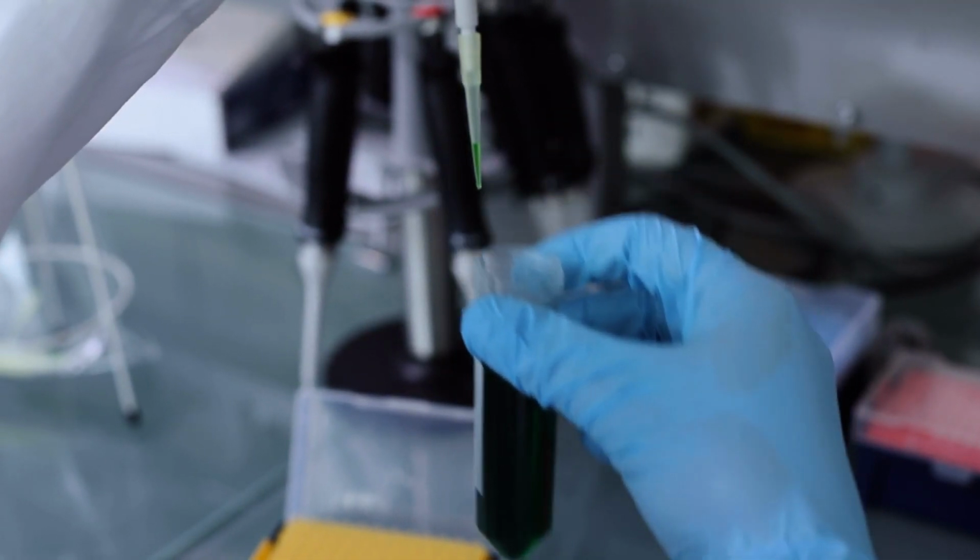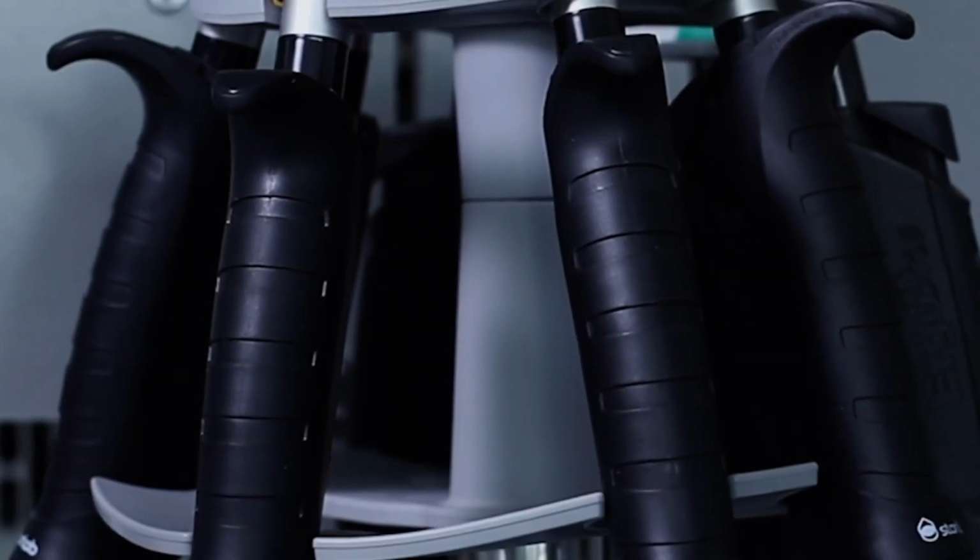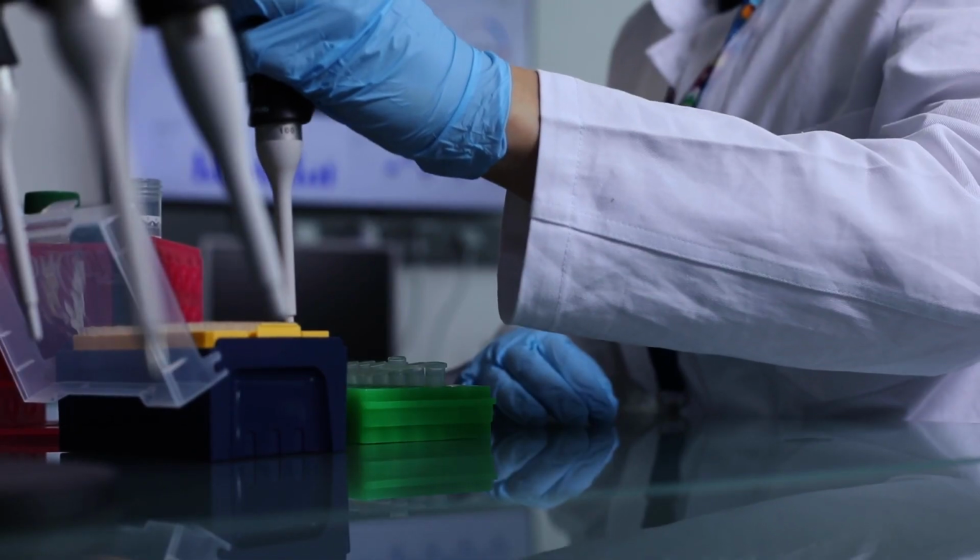Are you dispensing a sample of 20 microliters and it looks like this? The sample looks practically lost in the tip. This decreases accuracy, and your results might suffer. This is how to ensure the most accurate results when pipetting.